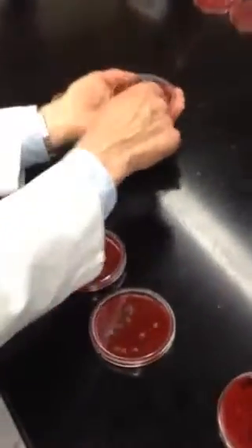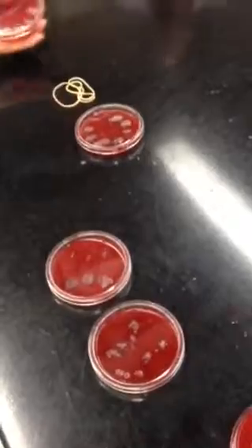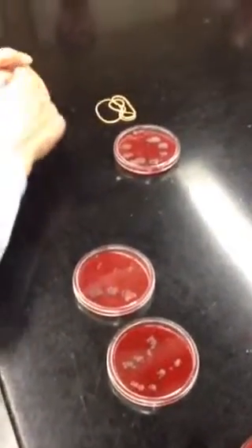Notice dry has growth. After rinsing with water for 30 seconds, even more growth. See it? Why is that? So when you see people going to the toilet here, and after they finish their thing, they go over to the sink, they wet their hands, and they're out of there. Well, that's what they're doing to themselves.